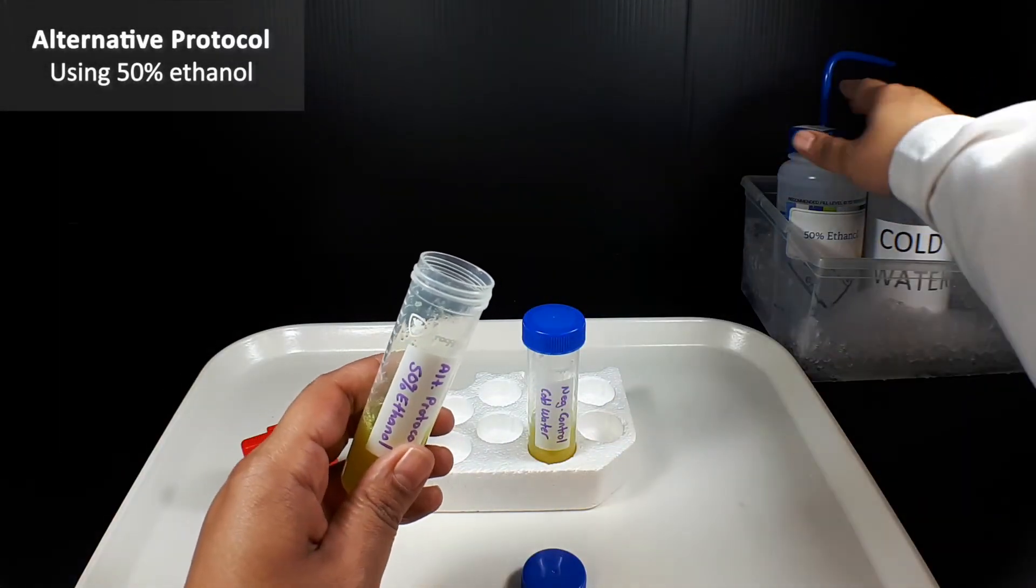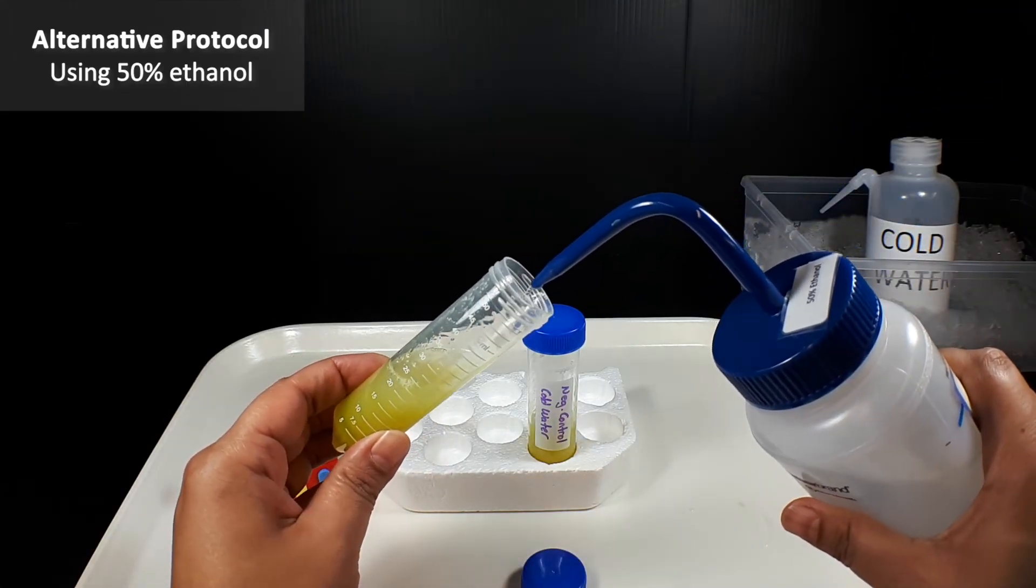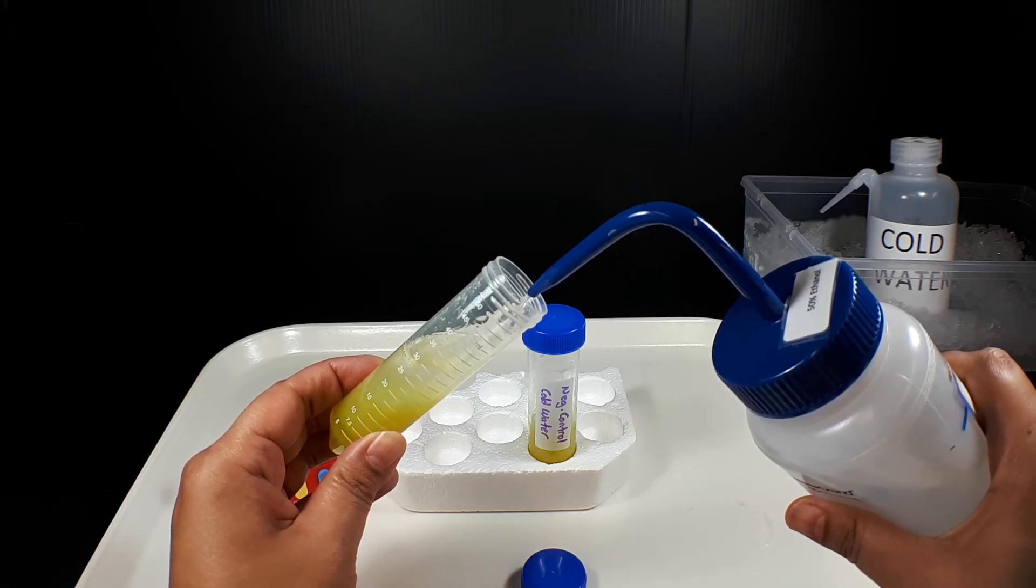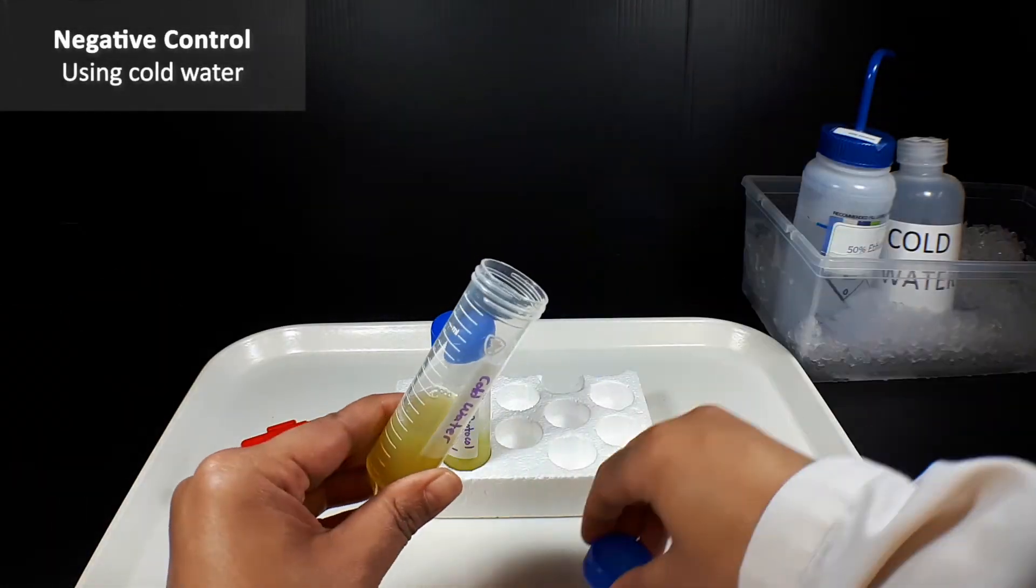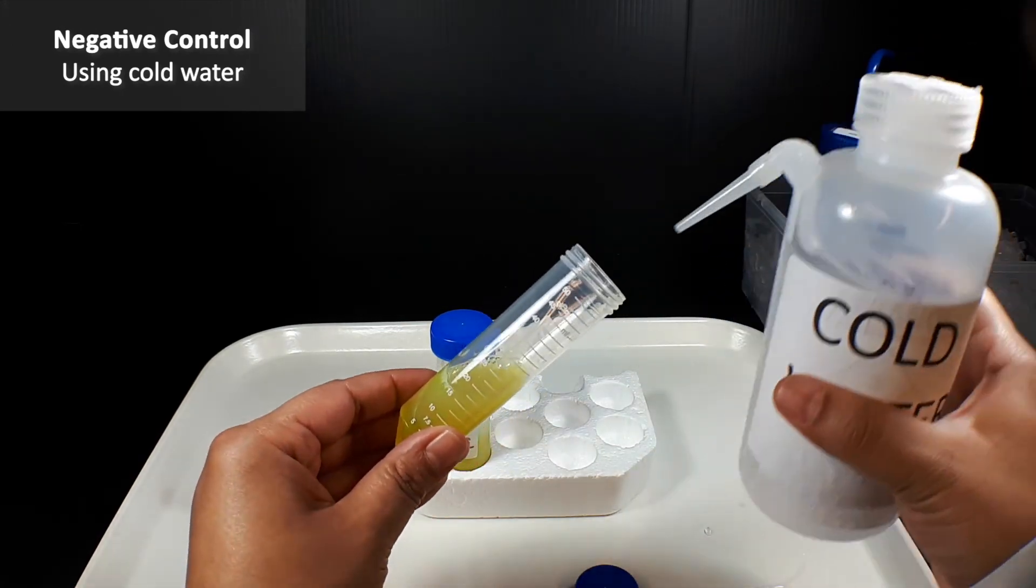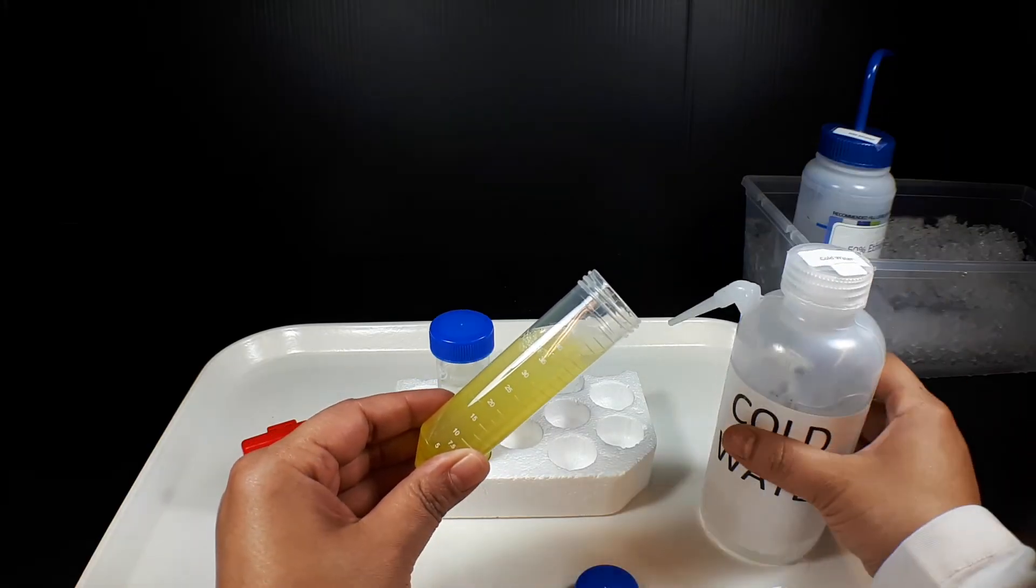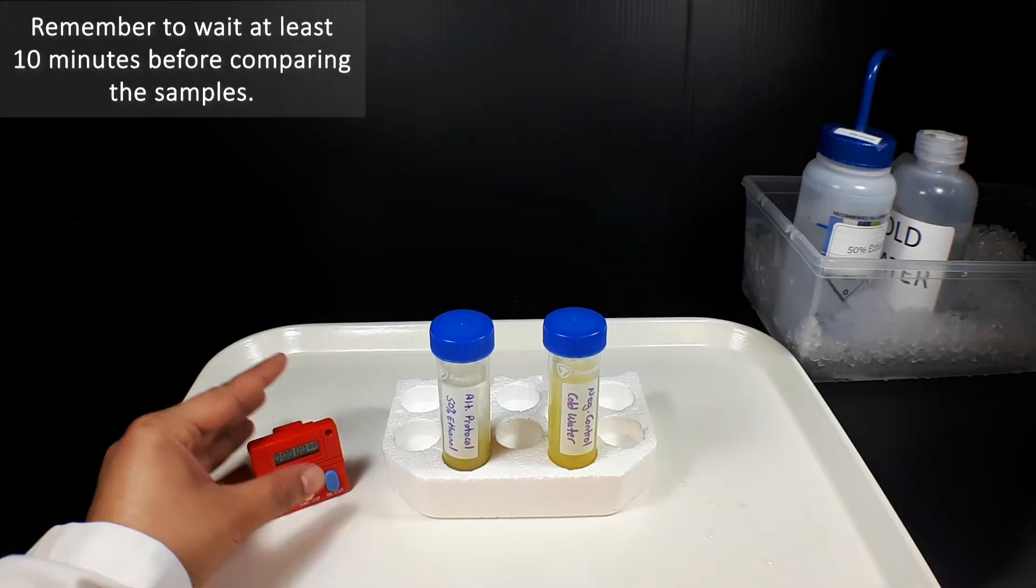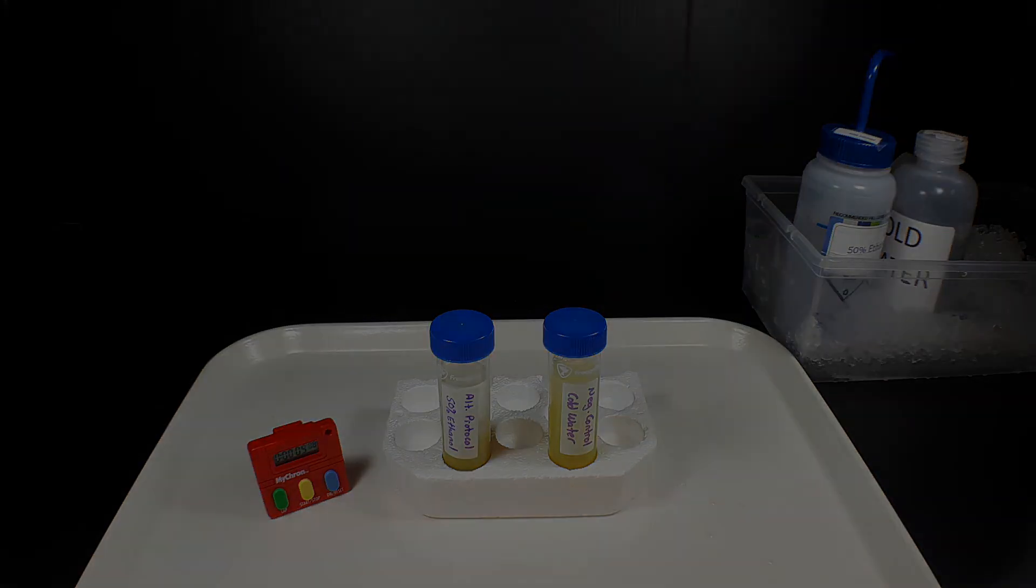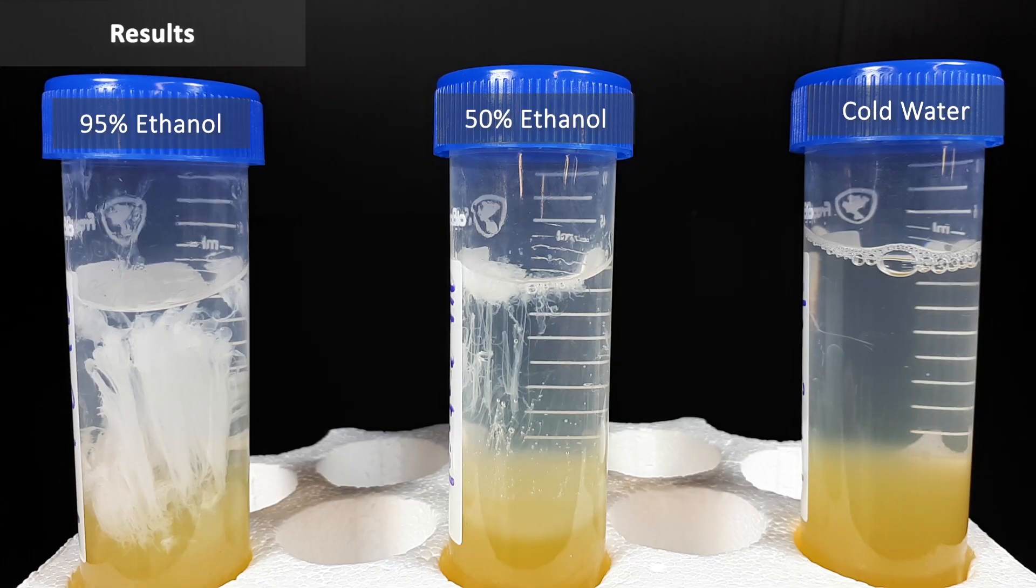To answer this question, we'll run the experiment again using either 50% ethanol or cold water to precipitate the DNA. All other steps will stay the same. Once we have all of our extractions ready, we can compare the results and answer our experimental question.